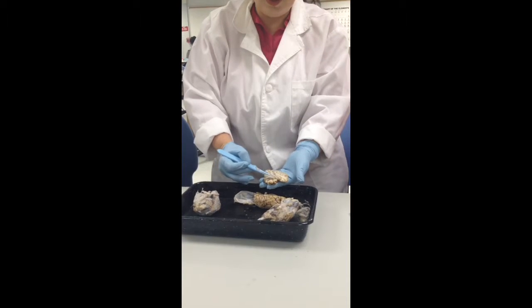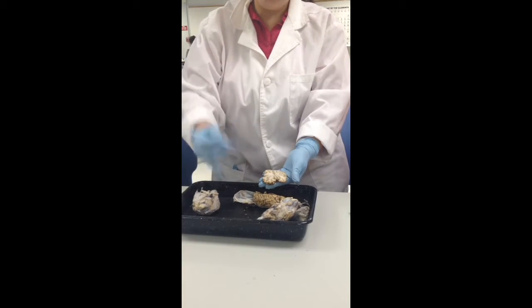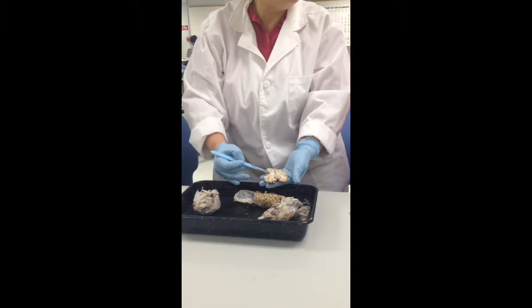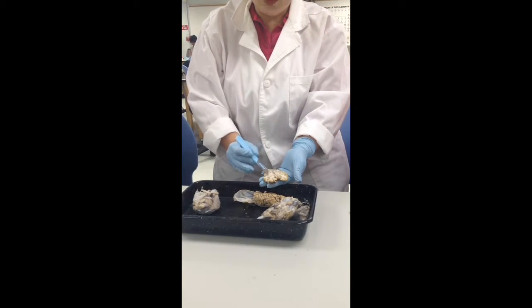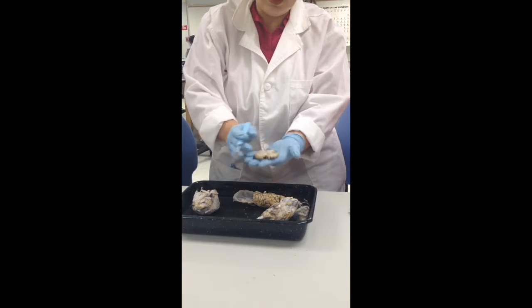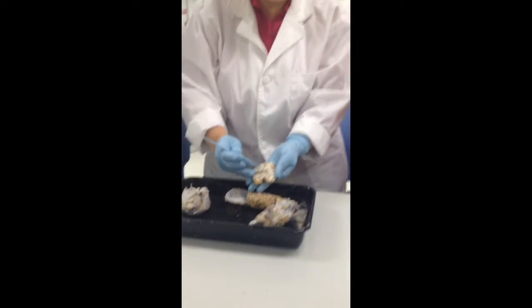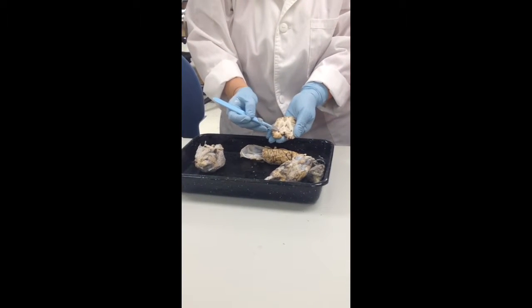These would be the fibers that are linking different parts of the brain. So if they're going up and down, they're projection. If they're going from the front to the back, they're association. And if they're going from this side to that side, they are commissural. Okay. Now, on this side of the brain, you can also see a cavity. What cavity is that? Lateral ventricle. Yes, this is the lateral ventricles.